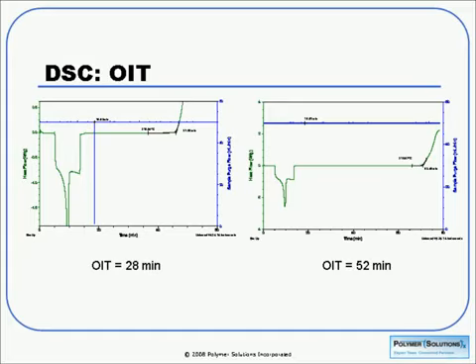I mentioned oxidative induction time, and the curves that we see here are related to that measurement. Basically, under actual use conditions, polymers will often experience degradation from oxidation. And oftentimes manufacturers add antioxidants in order to slow down that process. And we can use DSC to measure how well those materials are working. So take our sample and put it into an open pan. Doesn't have a lid on it in this case. We're going to heat it up to a specific temperature, usually 200 C for olefins in nitrogen. And then we're going to switch to oxygen and see how long it takes for the degradation to occur.